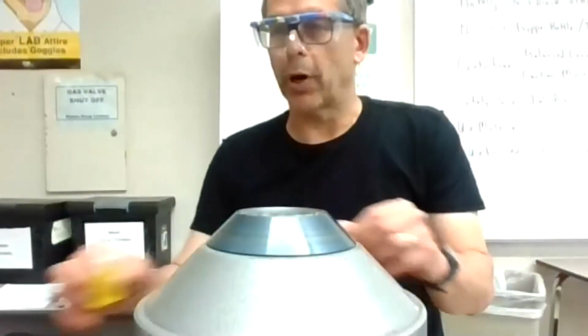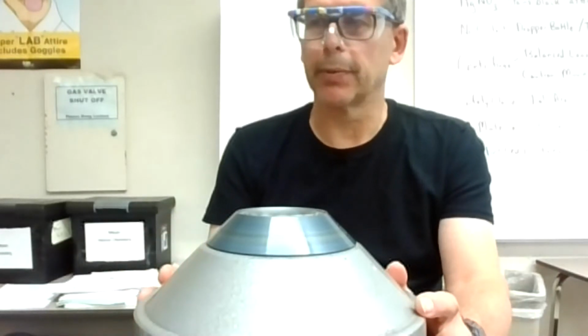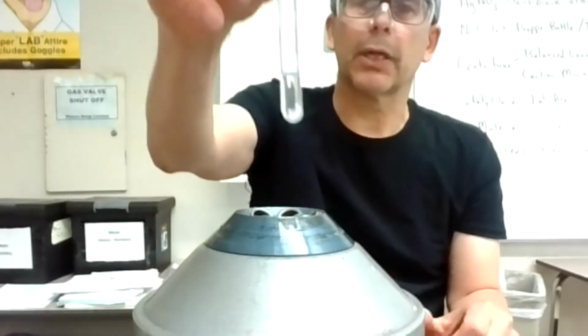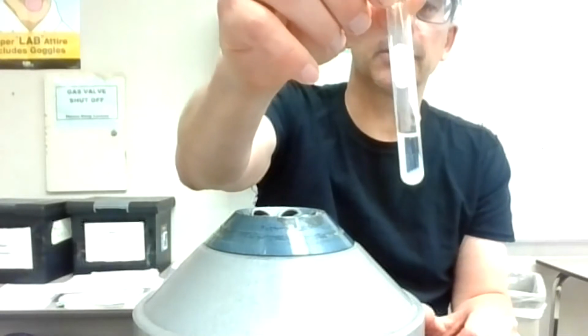I'm going to get ready. My next step would be to add the CrO4. I'm away from my flow chart. I think we can see these precipitates in that. Okay. Slow this down. Make sure my fingers aren't in there. Oh, look at, there's cloudiness at the bottom. It looks fluffy like Three Musketeers.